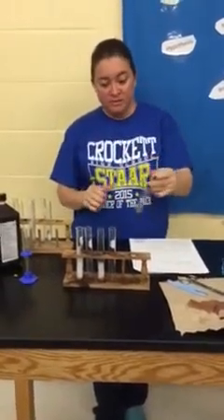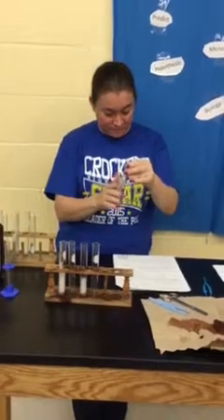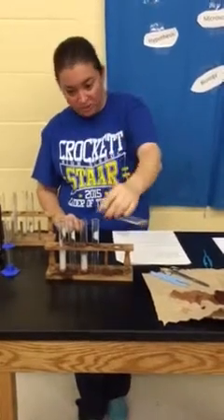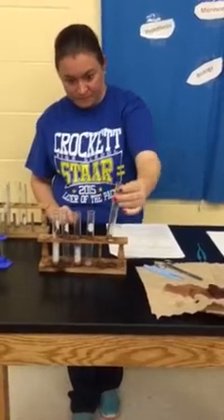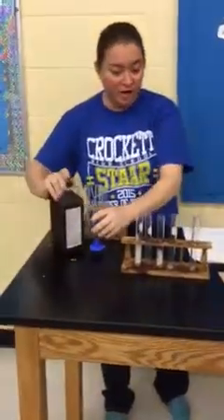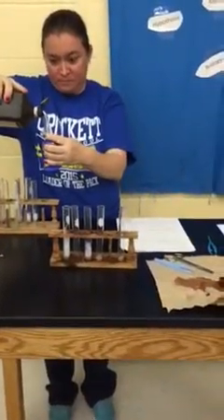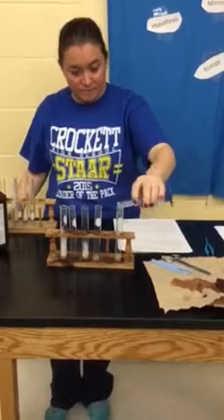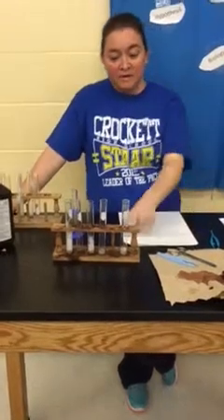This last one, trying to let it cool down just a little bit. It says to pour out the water, so I'm going to pour out the water and then add two milliliters of peroxide to it. And there you have it — measure that one's rate of reaction, zero to five.